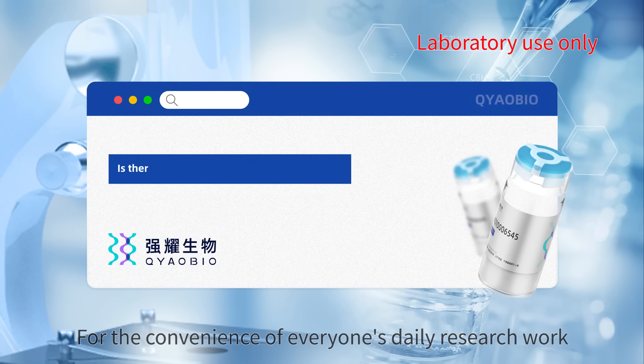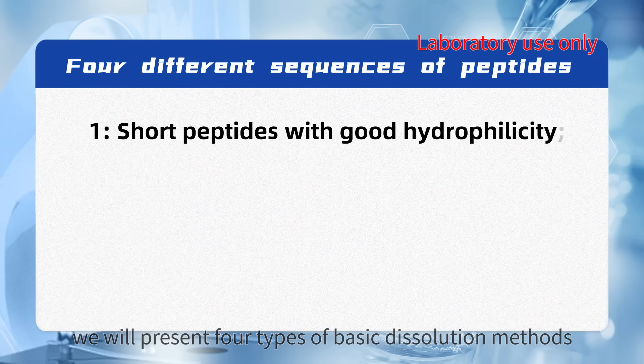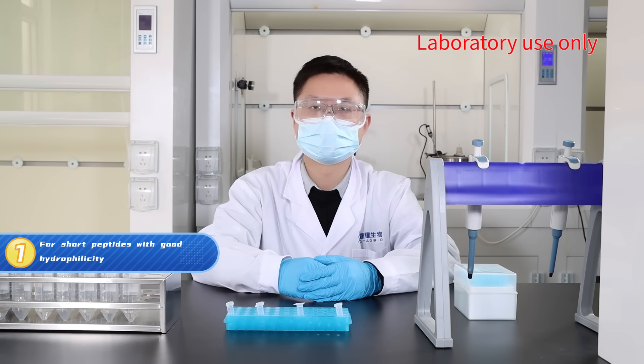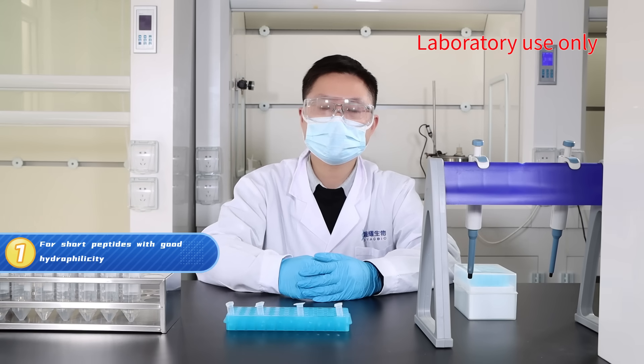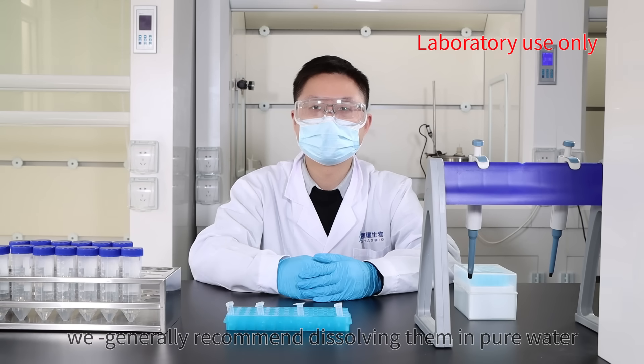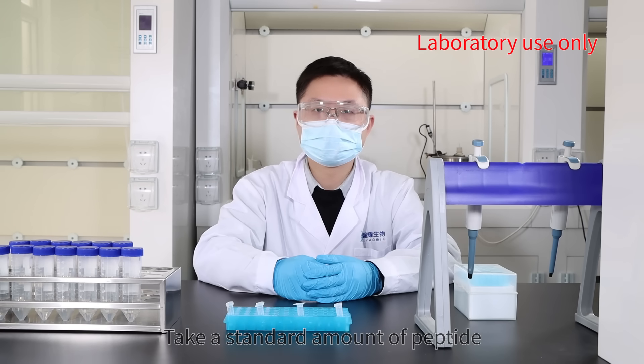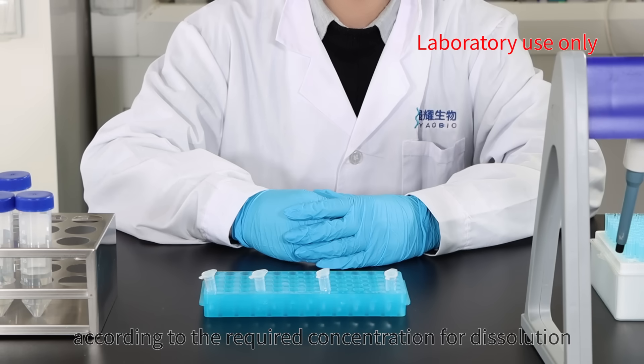We will present four types of basic dissolution methods. One, for short peptides with good hydrophilicity, we generally recommend dissolving them in pure water. Take a standard amount of peptide according to the required concentration for dissolution.